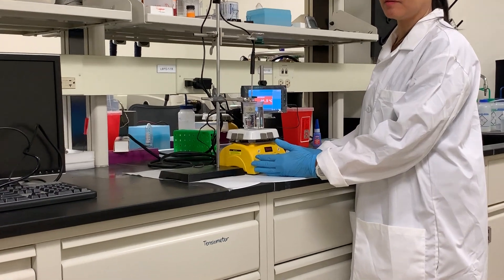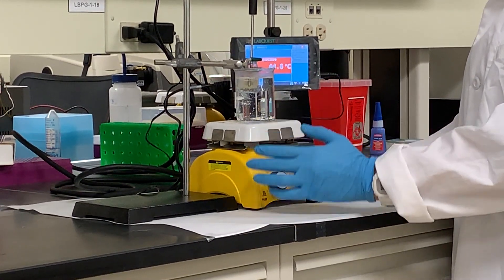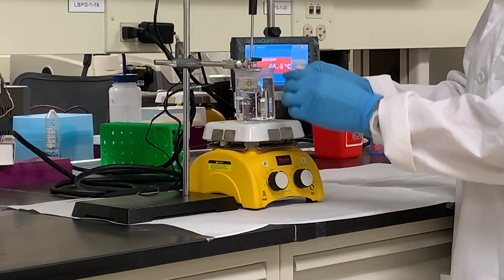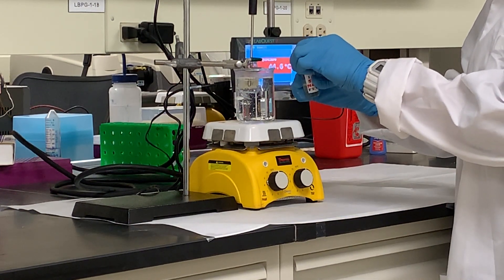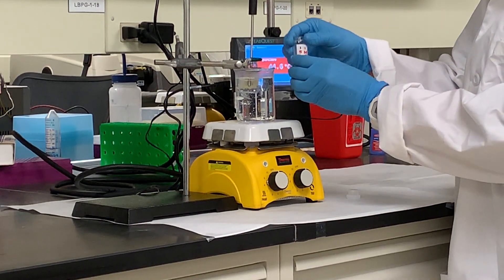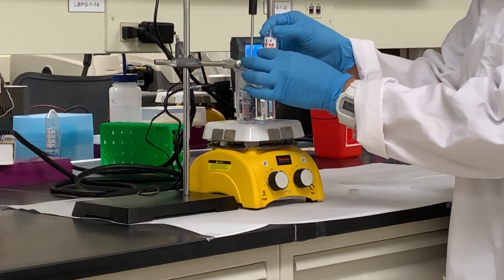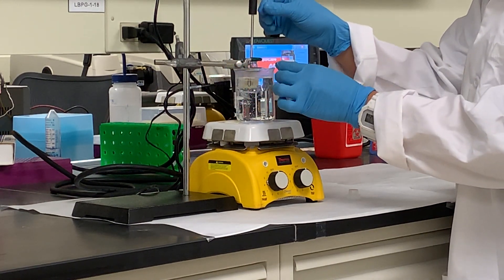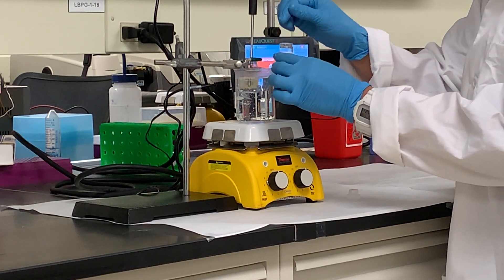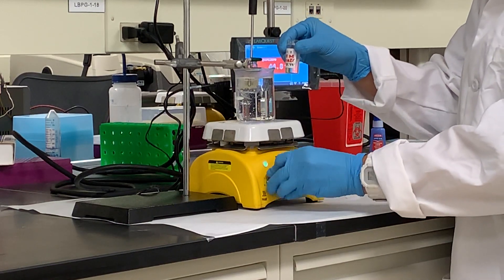This is how we perform the experiment. We use a hot plate, a beaker for a hot water bath, and a temperature probe. To put your sample in, first you have to uncap it and submerge it in the water bath. Make sure you clamp it, and then put your probe inside the solution, making sure that it doesn't touch the walls of the container. Now you turn on your hot plate.